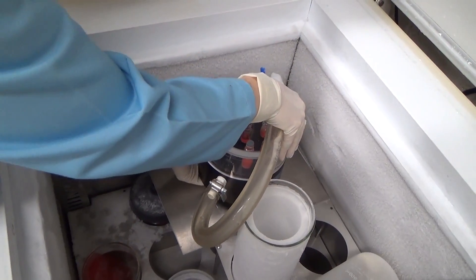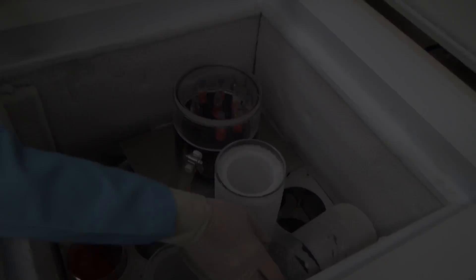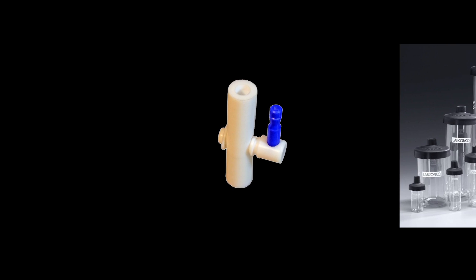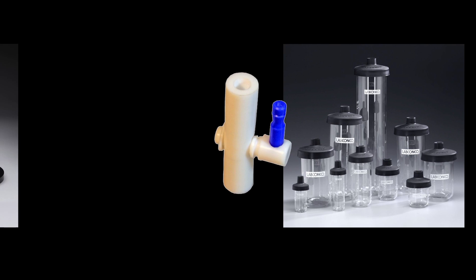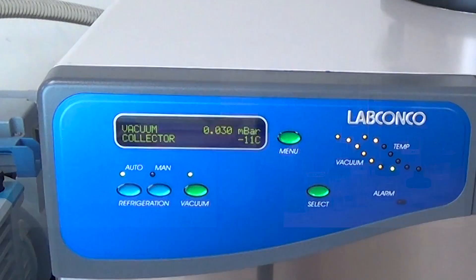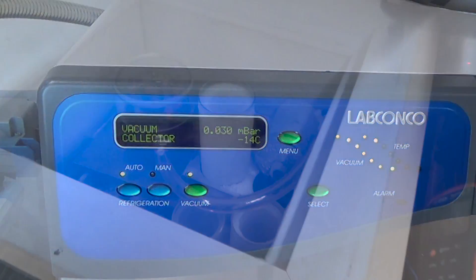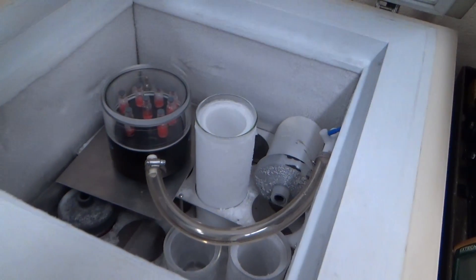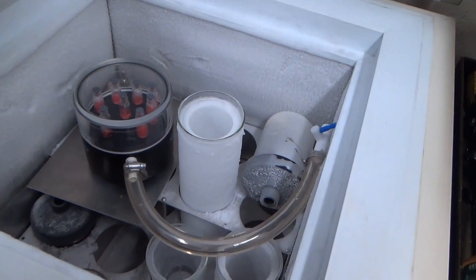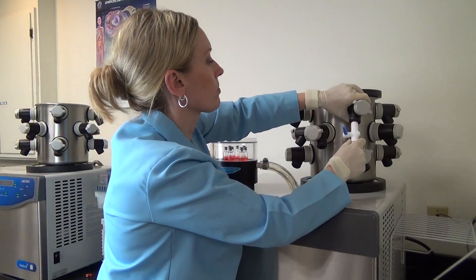Transfer the mini stoppering chamber to a freezer for pre-freezing. When using the aseptic adapter with either a fast freeze flask or with the mini stoppering chamber, you can begin prepping your freeze dryer when your samples are almost completely frozen. Once the condenser and vacuum have reached the correct operating levels for your application, it is important to make sure the samples are completely frozen — you may have to wait for freezing to complete.